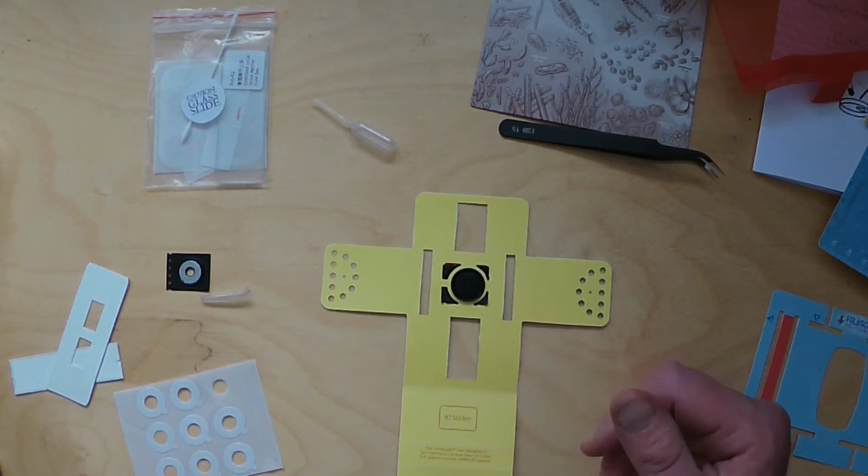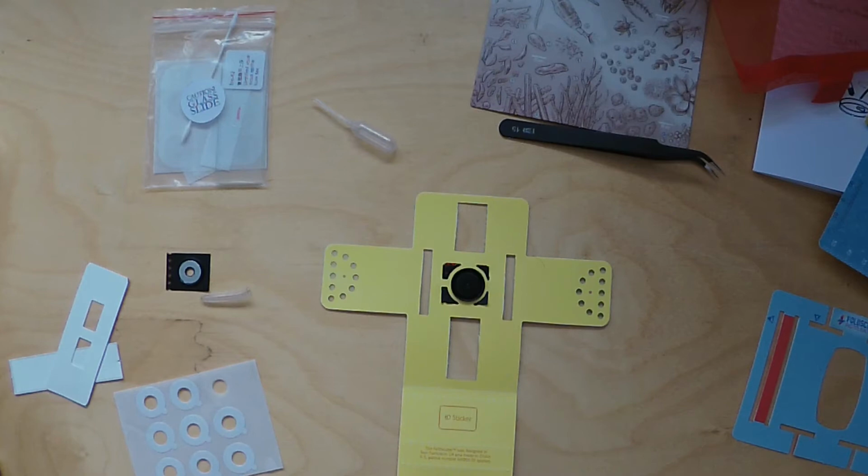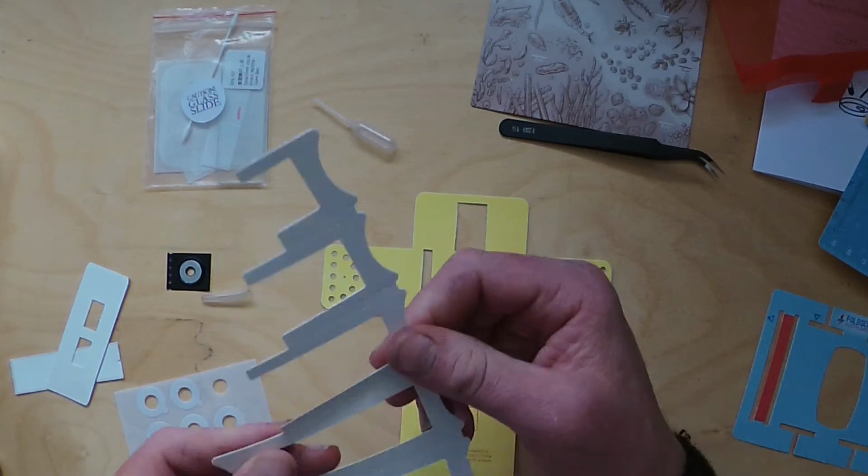The next step is your focus ramp, which I assembled earlier. That comes out of the net. It is actually possible to break off parts of this, so do be careful. I do remember doing that before.